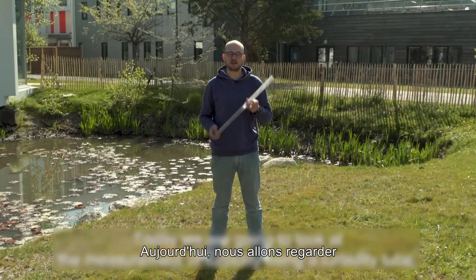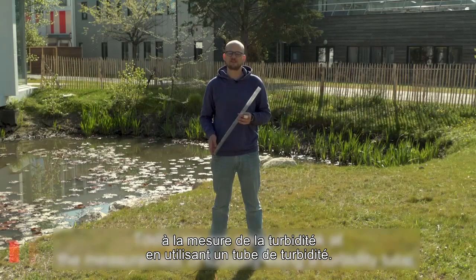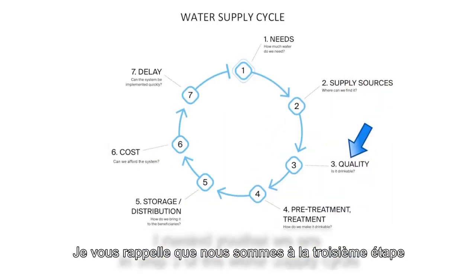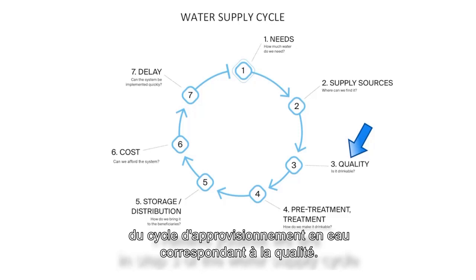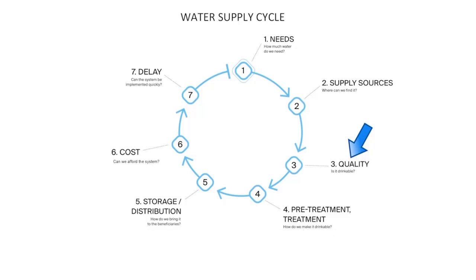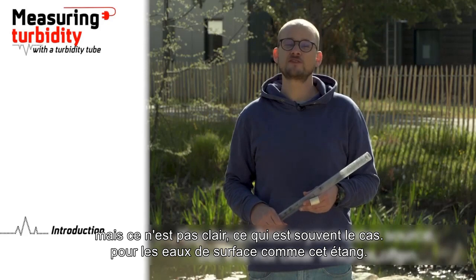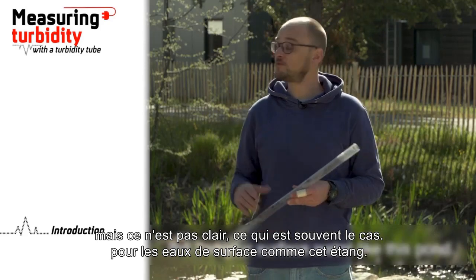Today we are going to look at the measurement of turbidity using a turbidity tube. I remind you that we are in step 3 of the water supply cycle corresponding to quality. You've chosen your water source, but it's not clear, which is often the case for surface water like this pond.